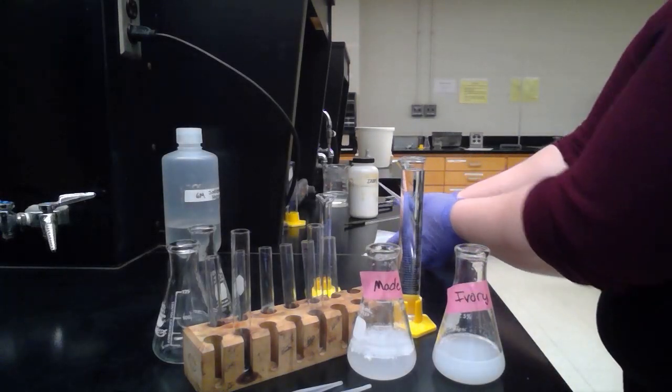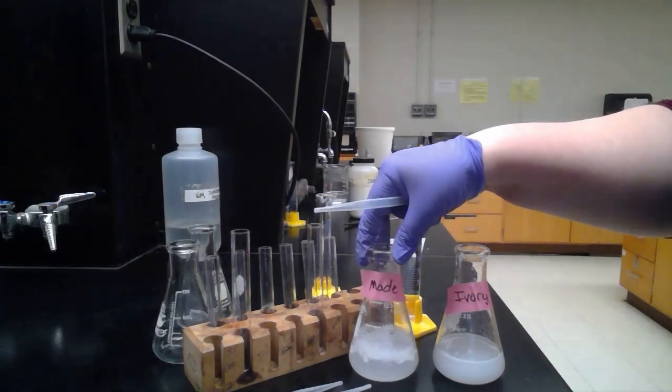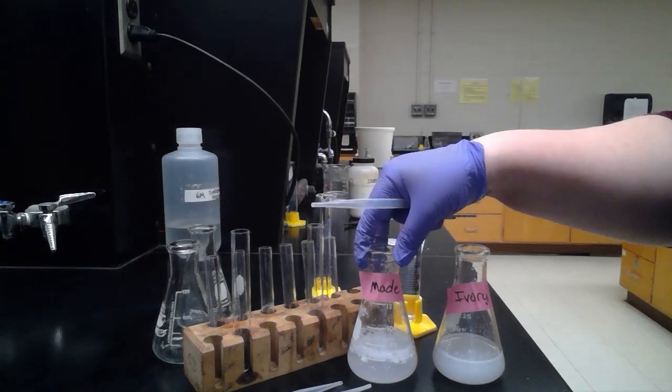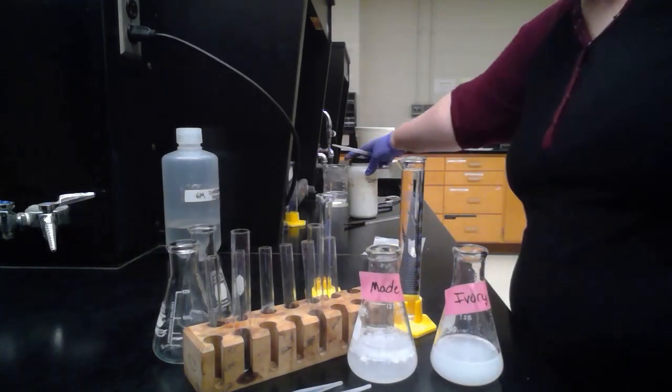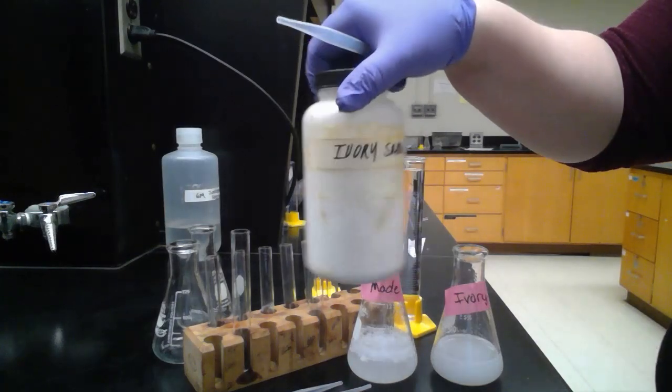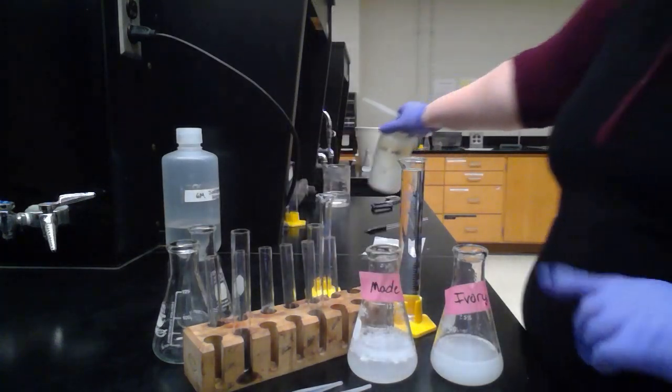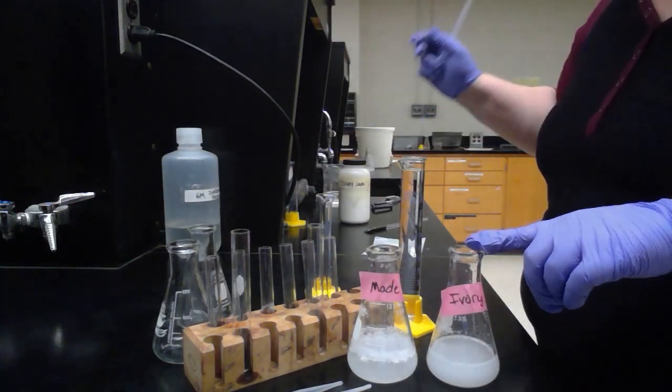Now I've taken about one gram of that and dissolved it in about 50 milliliters of water. And I've taken about one gram of the ivory soap, which is our control soap, and that I've dissolved also in another 50 milliliters of water.